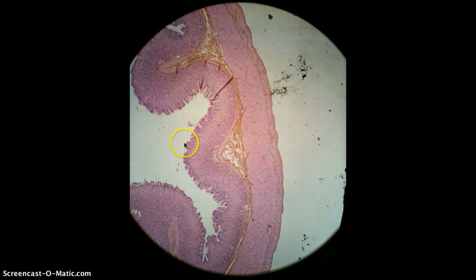Okay, and then we can start looking at the layers. So here's the lumen, here's going to be the inside of the stomach. So then just next to that, the layer is going to be the tunica mucosa. So from here, this purple edge, all the way to the back of the pink here, that layer is tunica mucosa. Then the layer after that is tunica submucosa, the orangey layer. Then after that, the pink layer is the tunica muscularis, or muscularis externa. And then after that, this line out here is going to be the tunica serosa.